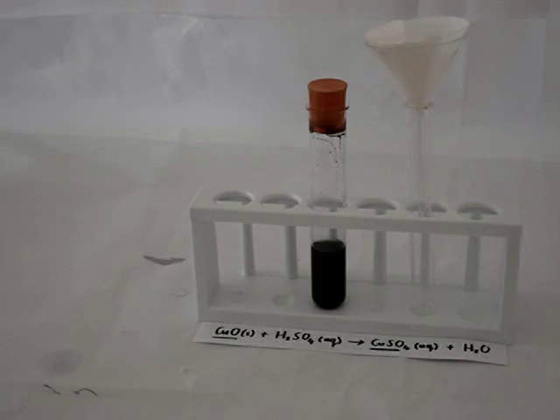The residue will remain behind - in other words, all the material that is not small enough to pass through the small holes in the filter paper - and the filtrate will go through.